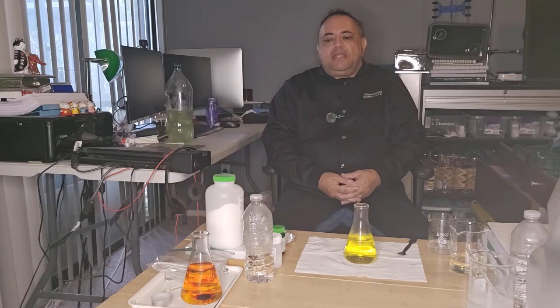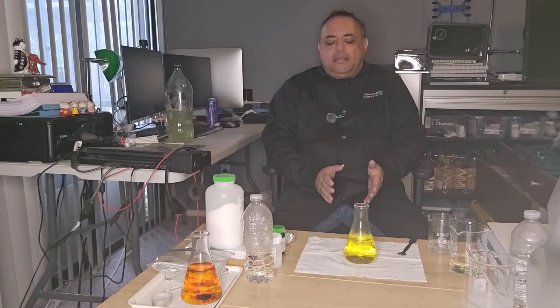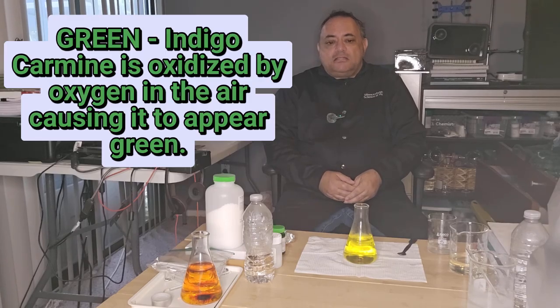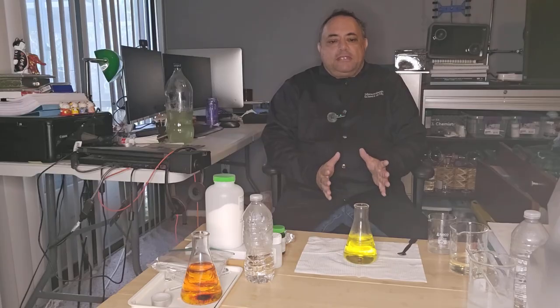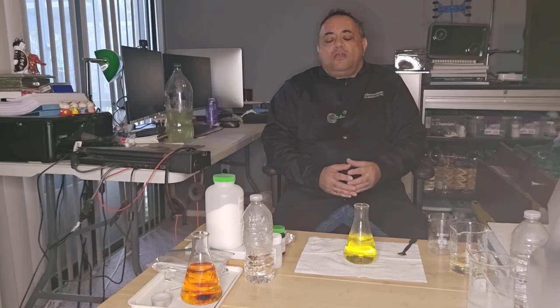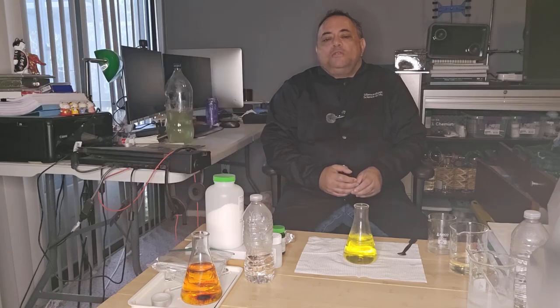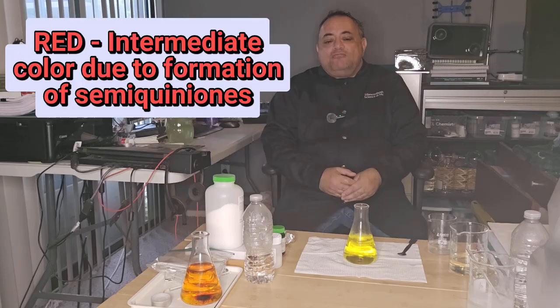Well, that was the chemical traffic light reaction demonstrating the redox indicator indigo carmine. Just to explain a little bit about the colors, the initial blue-green color that you saw is the indigo carmine being oxidized by oxygen in the air, causing it to appear green. This is the oxidized form of indigo carmine. The yellow-red color change is where the indigo carmine is reduced by the glucose, which removes oxygen and returns the dye to its original reduced state, causing the solution to turn yellow. The intermediate red color that you saw is the formation of semiquinones.